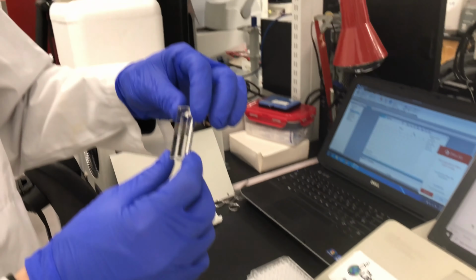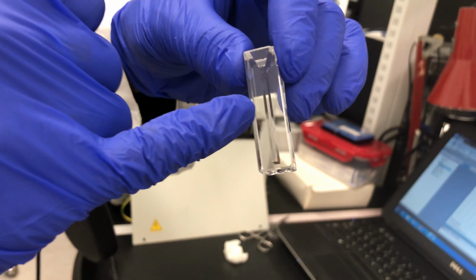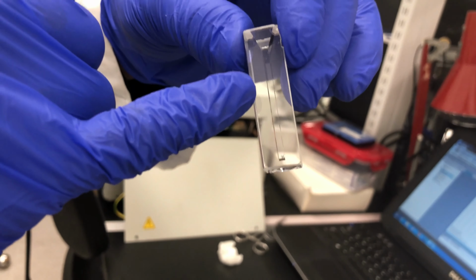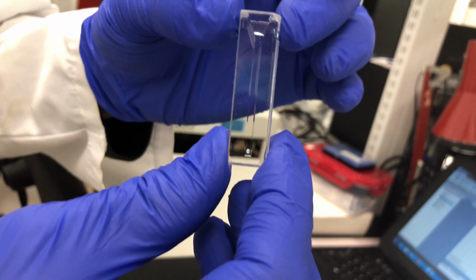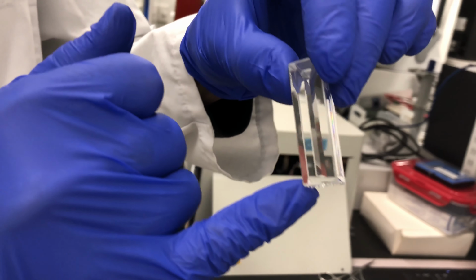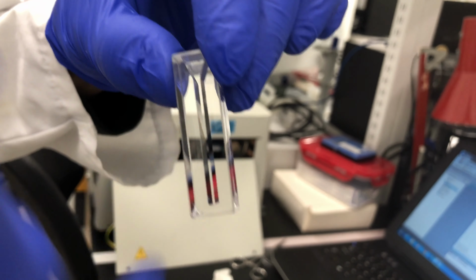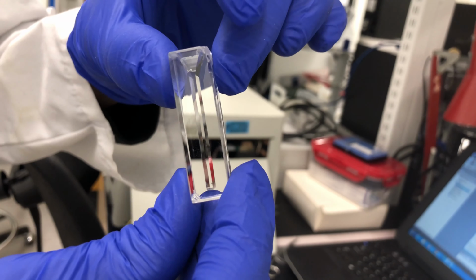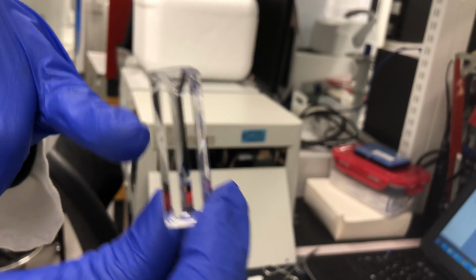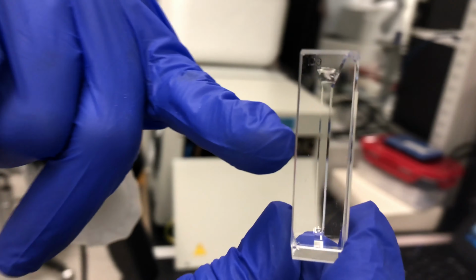The one I like is the quartz cuvette. The nice thing with this is that you can get different path. Basically, the path length is fixed, but you can actually get it reduced volume. So in this case, this would be probably less than a mil of liquid. And the nice thing with this one is that when the light comes through, you at least have a fixed path length, so that's always going to be consistent. So that reduces the amount of error that you're going to have when you do these readings.